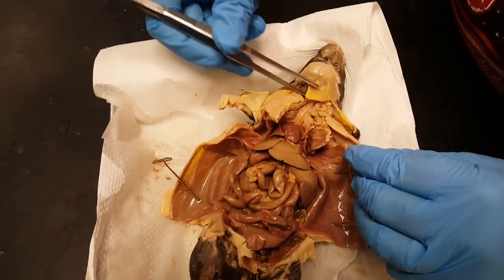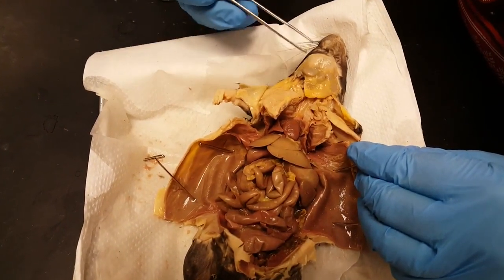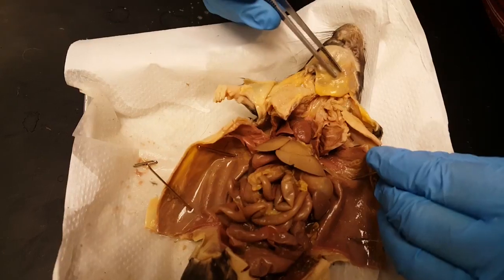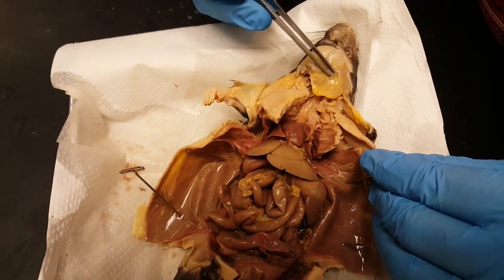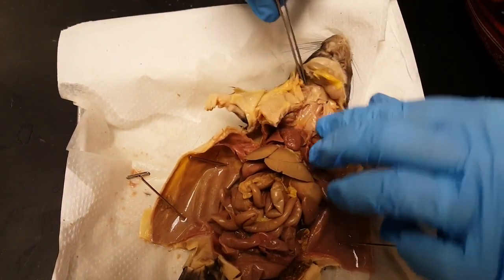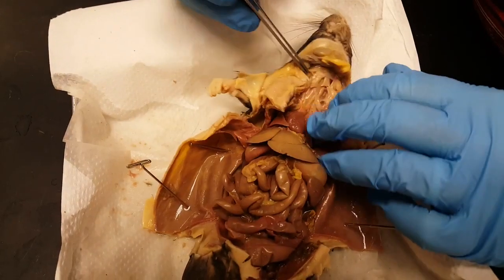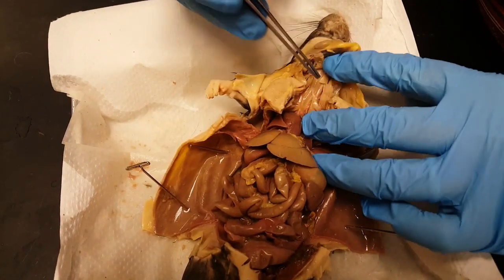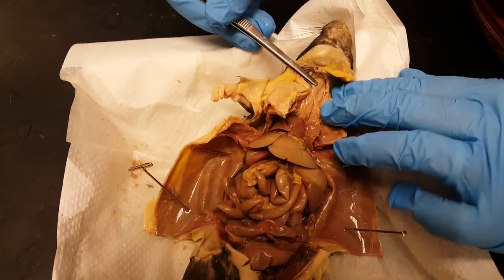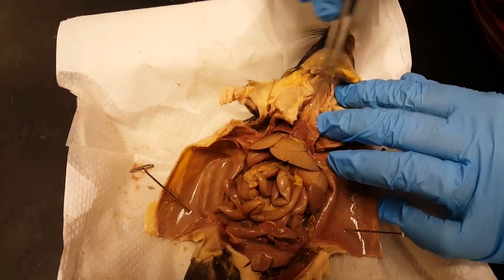Here in the neck, these are the salivary glands, and these little round things on top of them are the lymph nodes. If you lift that up, here in the neck area, this ringed structure is the trachea, and the esophagus is located next to it.